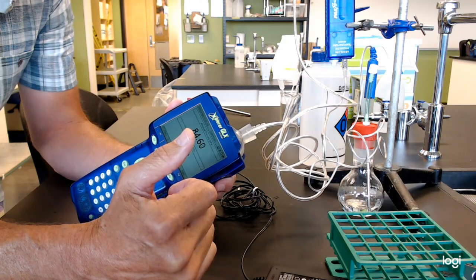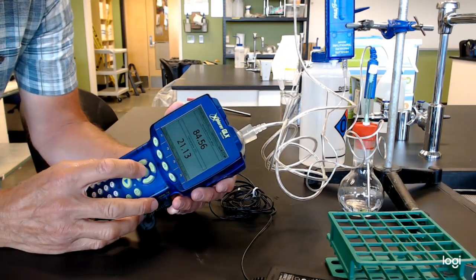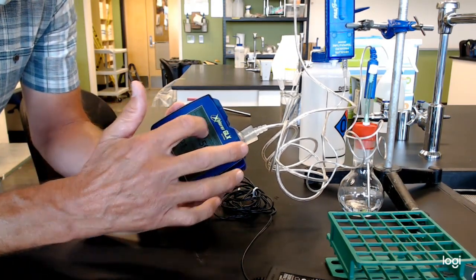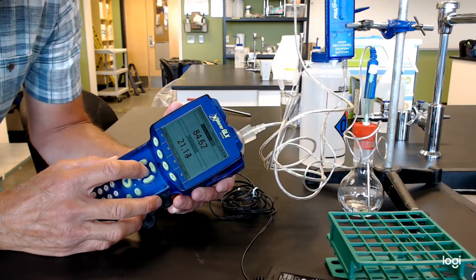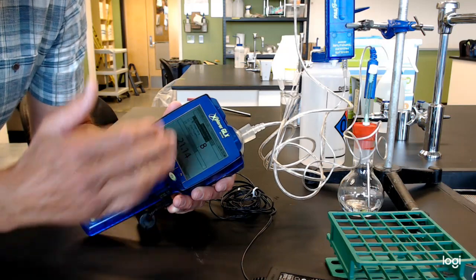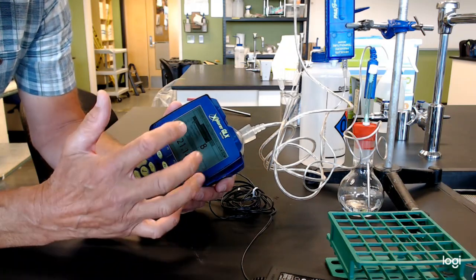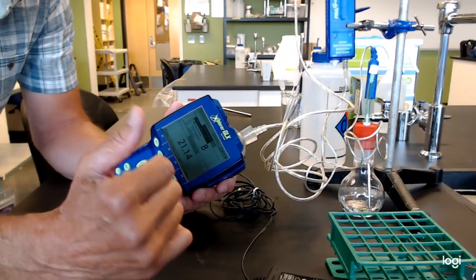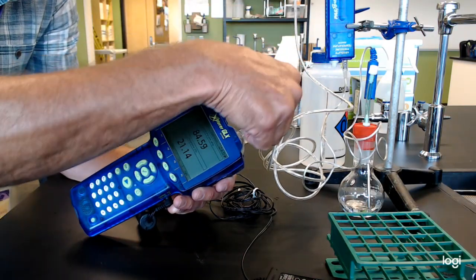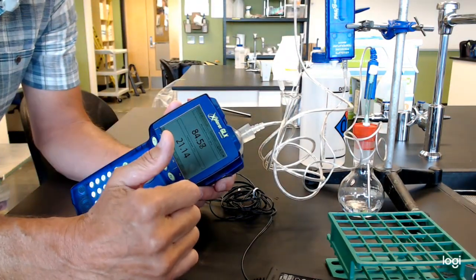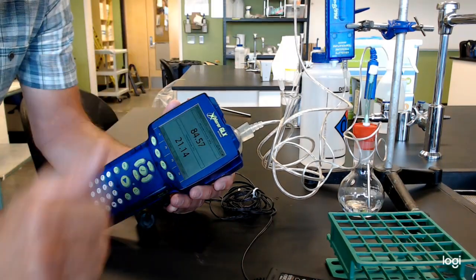Just so you know, some different scenarios that happen. Sometimes you turn these on, they're blank. You have a screen, but it's blank. Don't despair. Actually, up here in the heading, it says what sensor are you looking for. You can highlight it, click it again, and it pulls down and shows you the option. You could put pressure on the top or temperature on the top and switch them. If at that point you pull that screen down and you don't see any sensors registered, then you need to go back to shutdown and then turn it back up with these plugs. If you turn that on and pull that down and you don't see the sensor, then this box has not found that box.